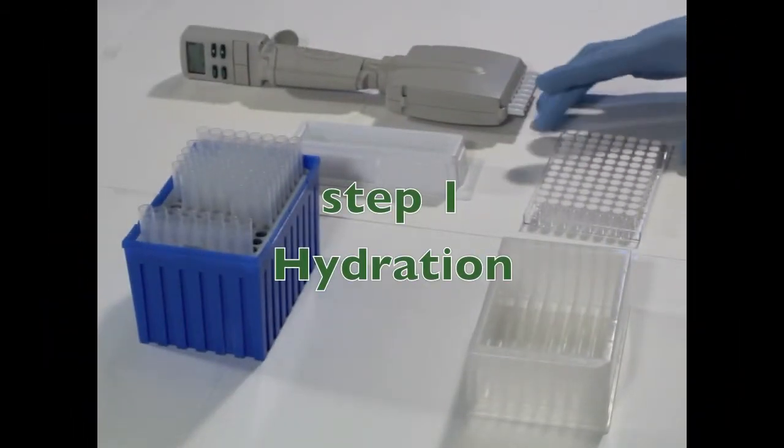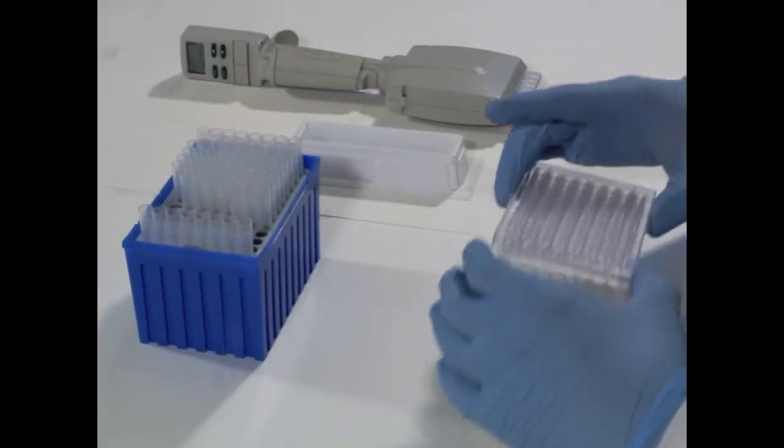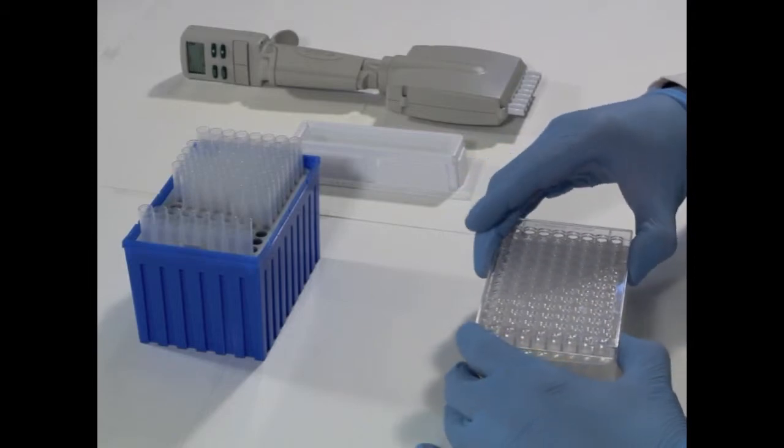First, the top plate of SkinPampa sandwiches is placed on top of the low-profile reservoir.